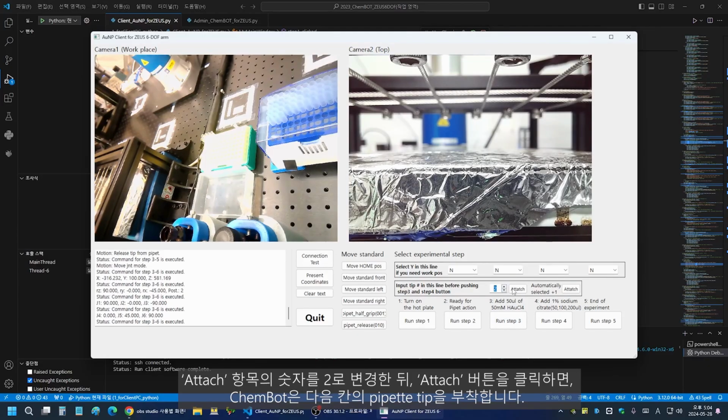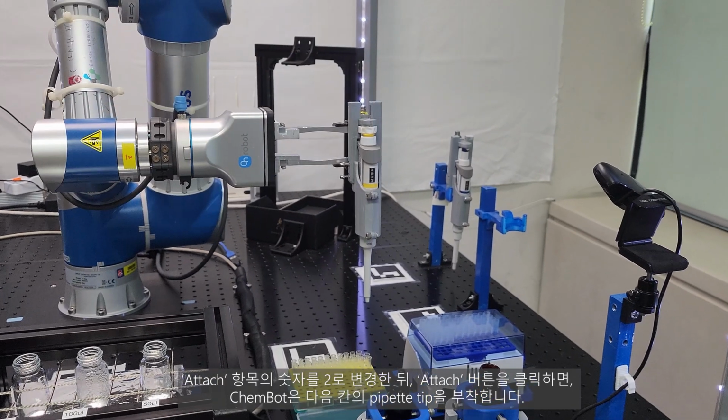Change the number in the Attach field to 2, then click the Attach button. ChemBot will attach a pipette tip from the next slot.